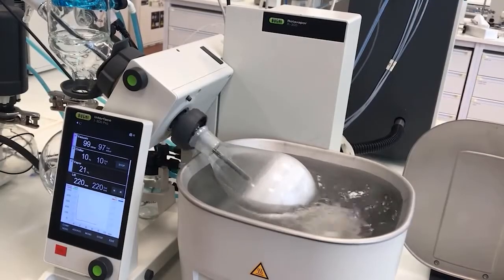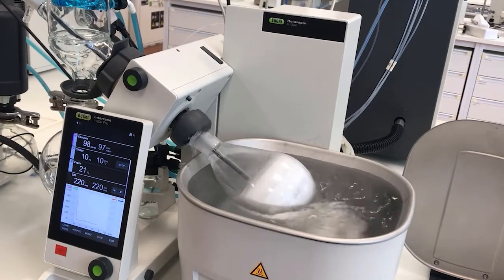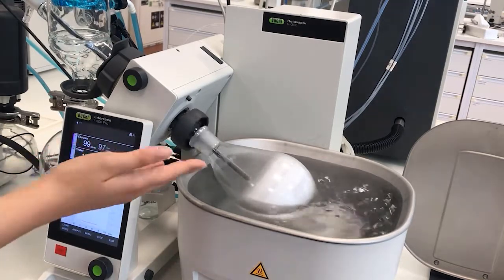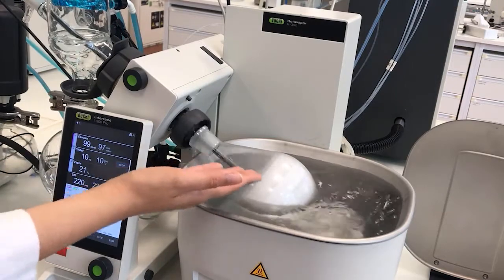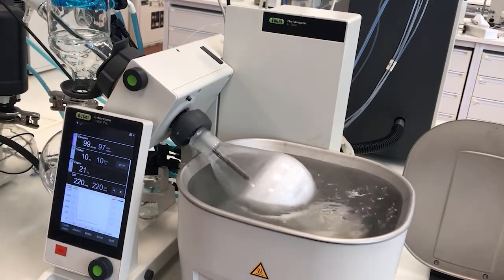Now comes the end of the distillation. We need to choose between concentration or drying. In our case, we had to dry our sample, so as you can see, the sample is now completely dried and is a white powder. We know that the evaporation is finished because there are no condensation droplets falling from the condenser coils. Or we can also see that from a sudden decrease of vapor temperature.